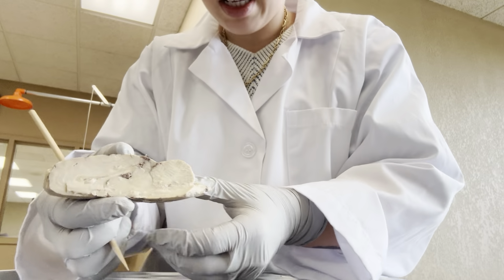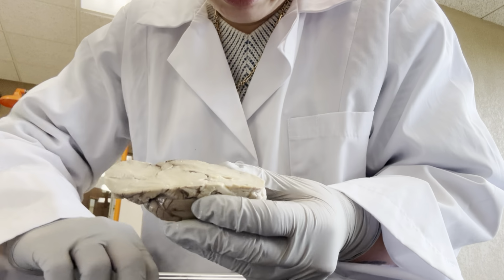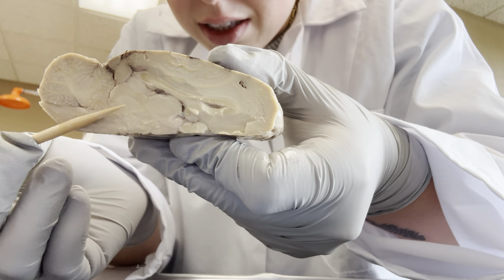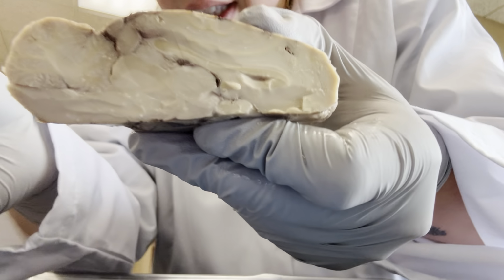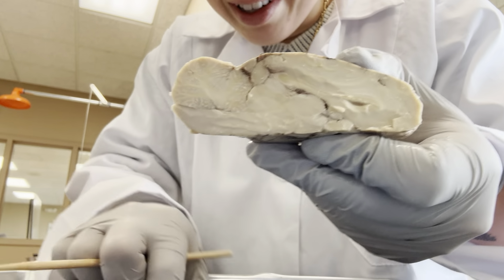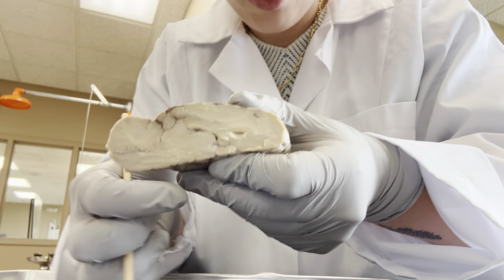So this is our left side, and we can kind of see the same thing in our right here. Again, we have the thalamus, we have the inferior and superior colliculus. We can see the arbor vitae in the cerebellum, the end of our brainstem, which we more have on this side, the medulla and the pons there.